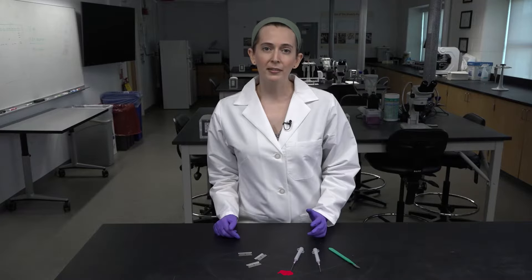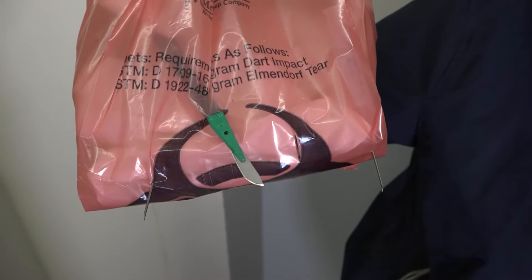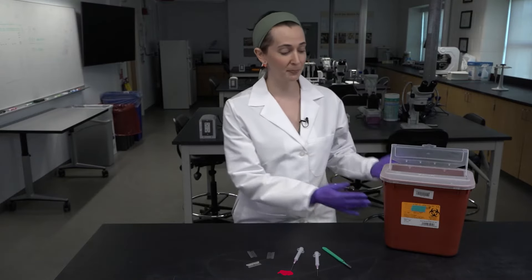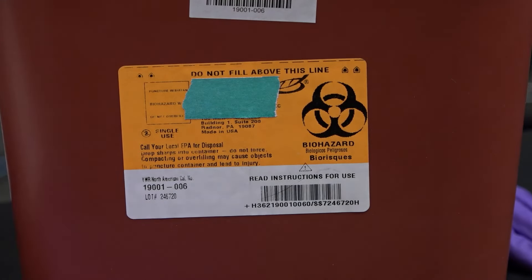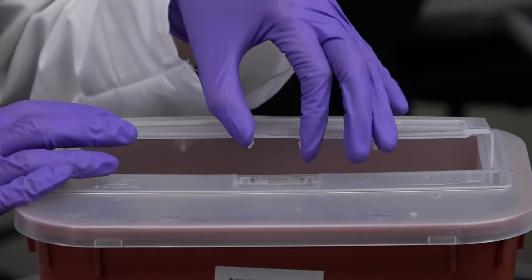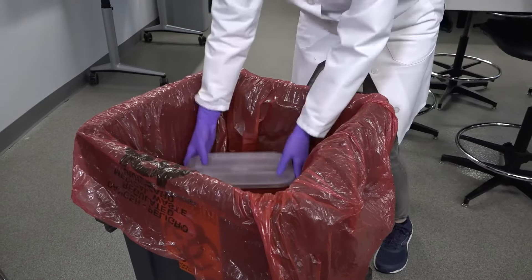Because the solid waste is collected in plastic bags, you cannot put sharps like needles or blades in there. They'll poke right through the plastic, it'll leak biowaste everywhere, and it can harm the person collecting the bags. Sharps contaminated with biowaste need to go in special plastic containers that can't be punctured. They're usually red and stamped with the universal symbol for biowaste. When they're three quarters full, secure the lid and dispose of the sharps bin according to your EHS guidelines. Here, we can put the sealed sharps bin in the larger biowaste container for solids.